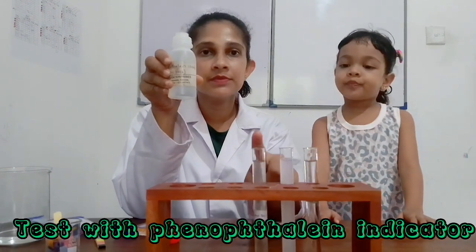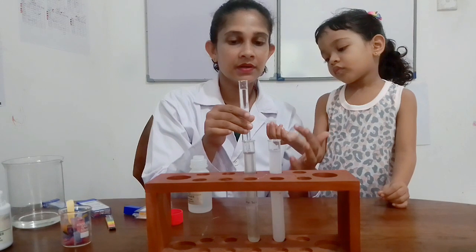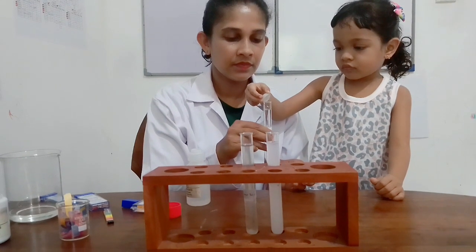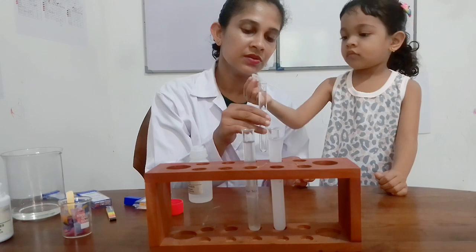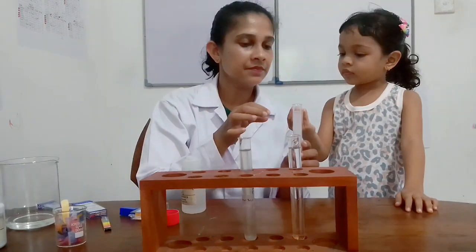Now I am going to try the phenolphthalein indicator with Jeevani solution, soap solution and lime juice solution. We are going to add a few drops of phenolphthalein indicator into the Jeevani solution. Color change or not? No color change with Jeevani solution. Add a few drops of phenolphthalein indicator into soap solution.